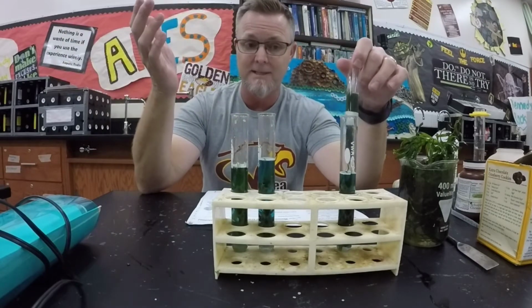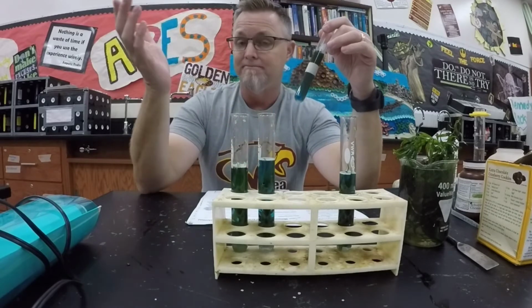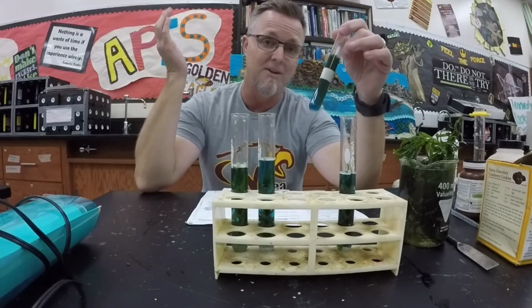And we're going to wait to see what happens. Right now, they're blue, so maybe we'll get to see a color change. Let's see. I'll see you in about an hour.